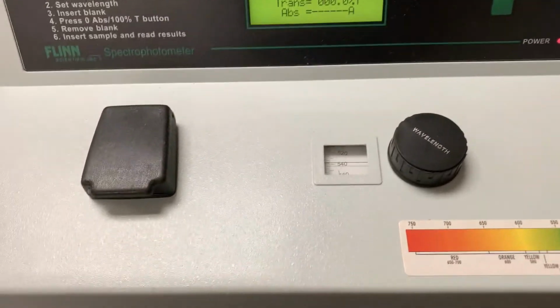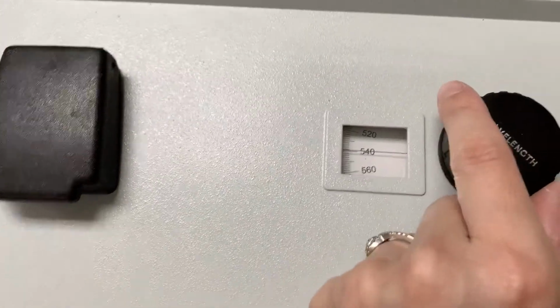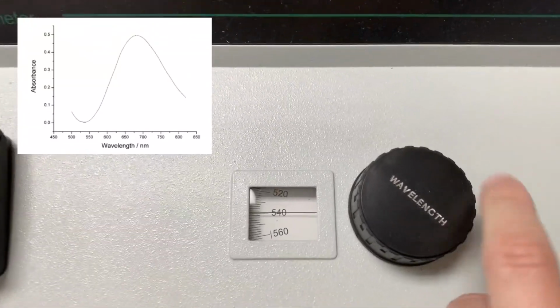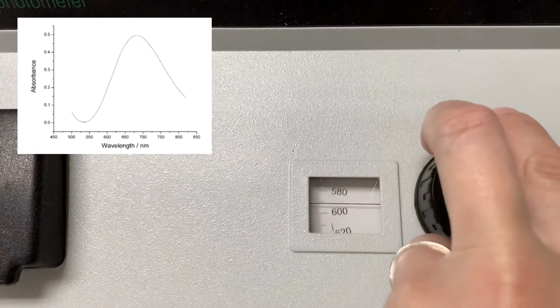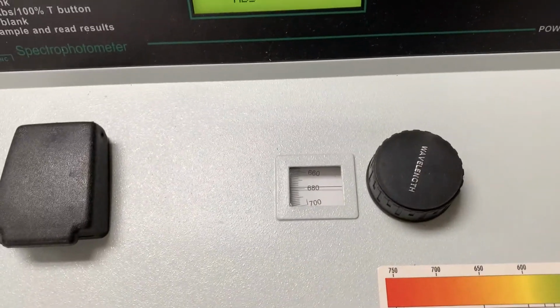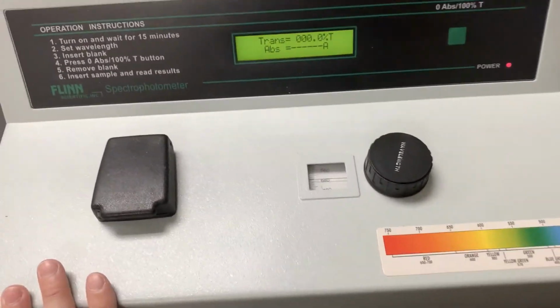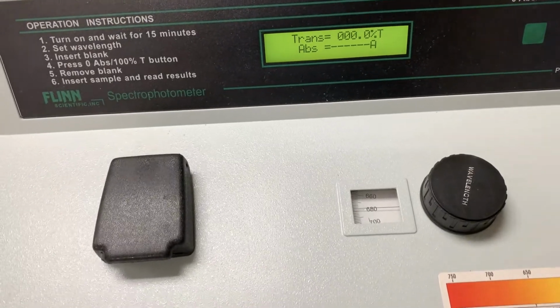I now need to set my wavelength before I can do anything else. If you notice here, we had noted the best wavelength: remember, we want maximum absorbance, but we want the absorbance to be under 1. So I'm going to set my wavelength to 680. Okay, and then after I set it, I don't need to deal with anything else with respect to wavelength. That tells my spectrophotometer to shoot out electromagnetic radiation that has a wavelength of 680. So I'm not going to change that at all.